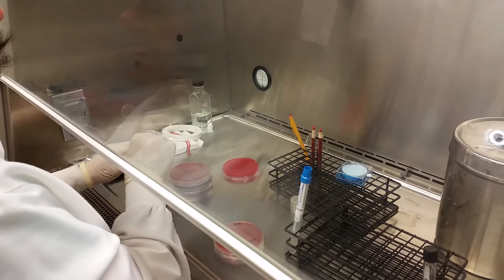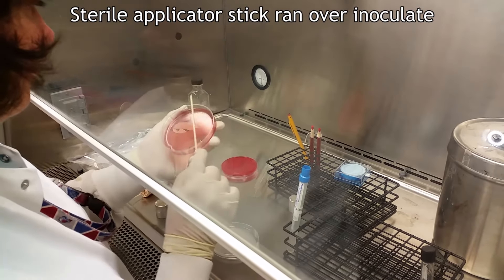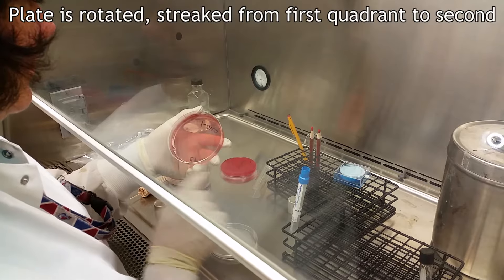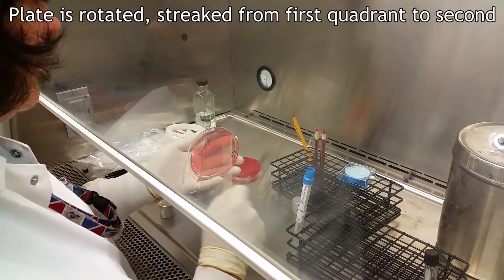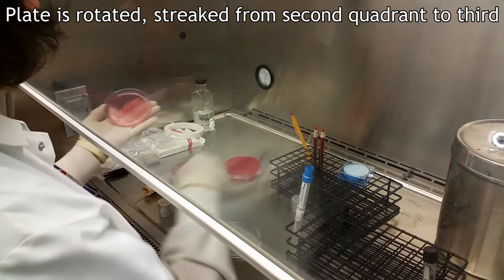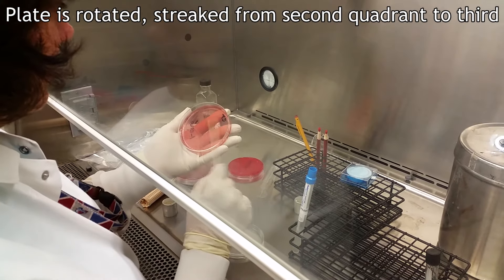First, a sterile applicator stick is run in a zig-zag motion over the initial inoculation streak. Then the plate is rotated and the bacteria is streaked from the first quadrant into the second. The plate is rotated again and is streaked from the second quadrant to the third.